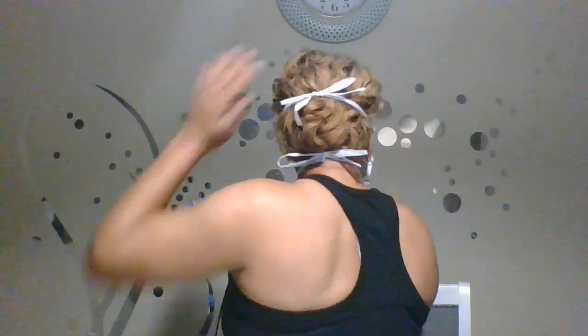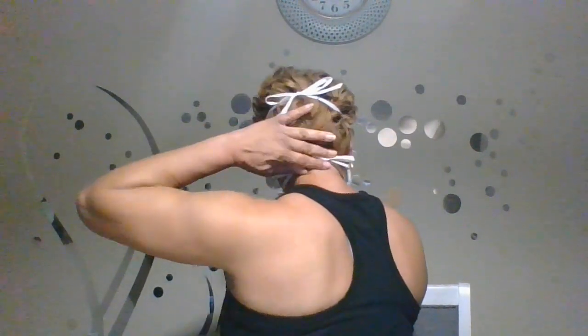When you tie the straps, make sure you don't tie them in a knot — either tie a loose bow or a slip knot. The bottom straps — you can also call these the neck straps — will go right at the top of your neck. I'll turn around so you can see how I have it tied in the back: top strap and bottom strap.